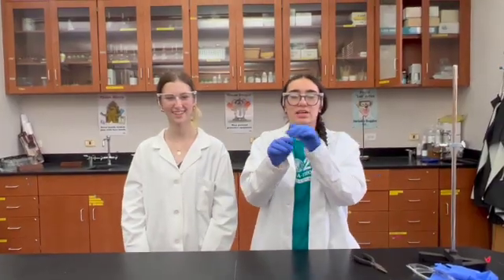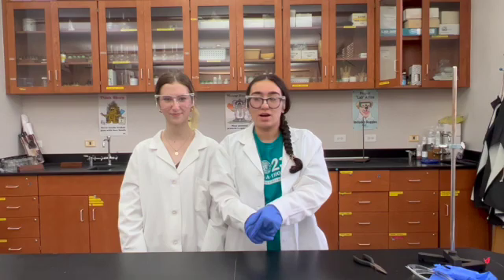For this lab, we need to make sure we're safe. So, get your goggles and your gloves.